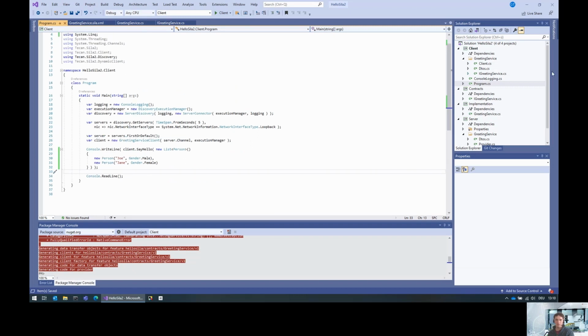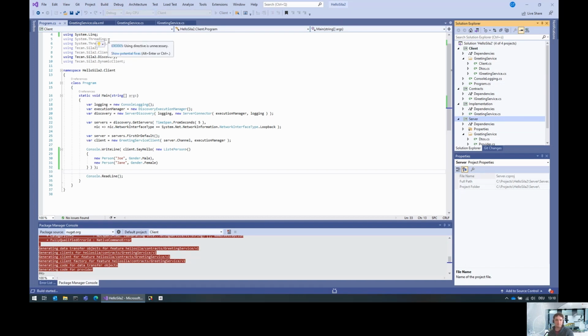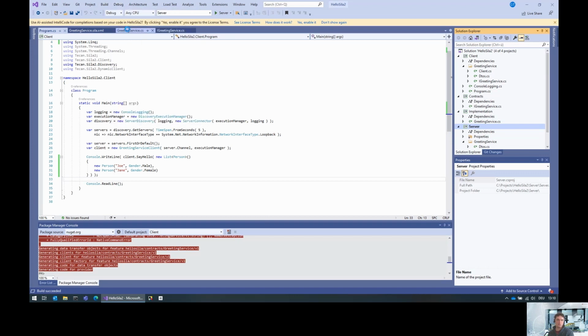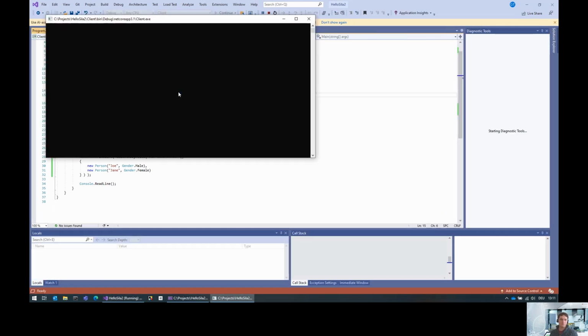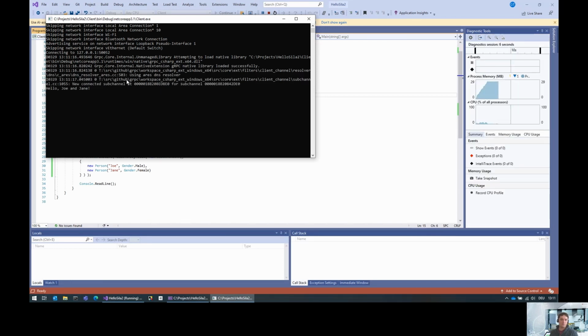If we execute this, let's first build the solution. Then again, we start the server, and then the client. Now we have this 5 seconds timeout for the discovery. And then the response is, hello, Joe and Jane.